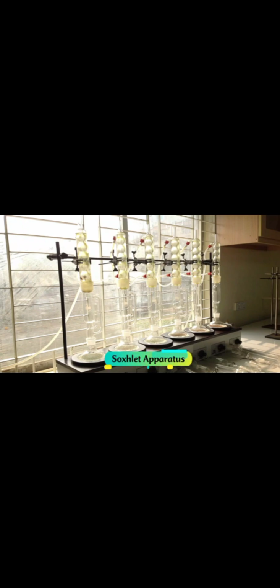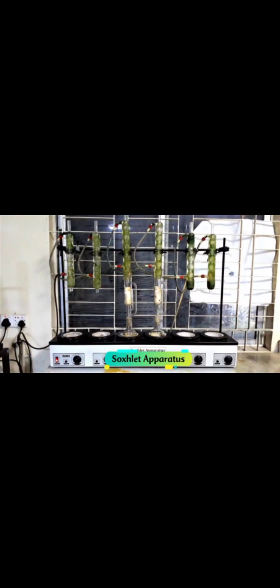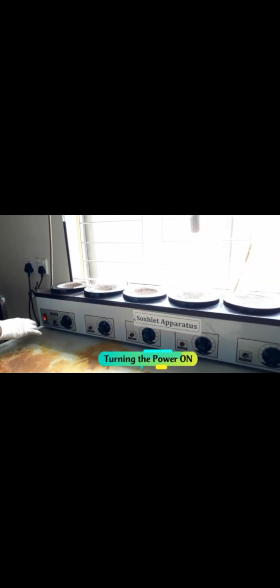Soxhlet apparatus. A Soxhlet apparatus is used mainly in solvent extraction. It is made up of different components such as a round bottom flask, a sample chamber with a thimble in which the sample is placed, a heating mantle with which the temperature is regulated to suit the boiling point of the solvent used in the analysis or in the extraction process.